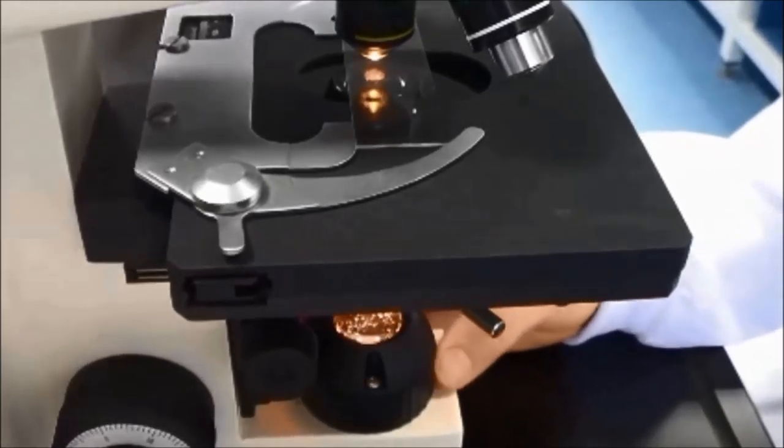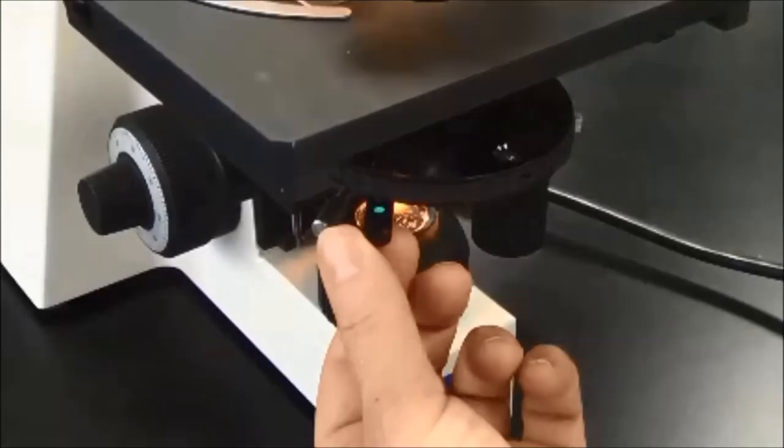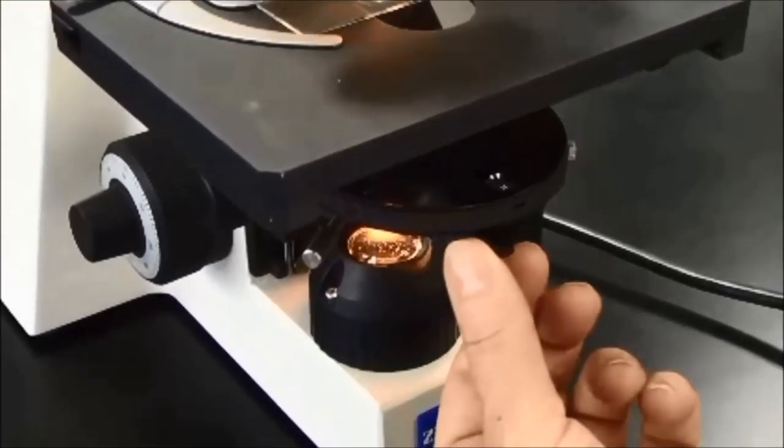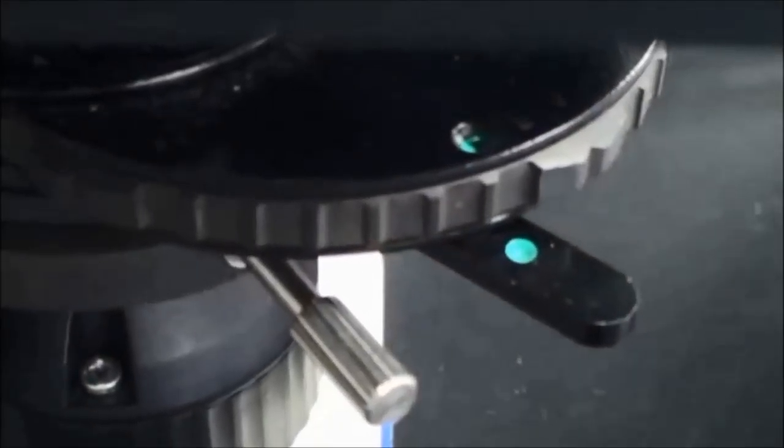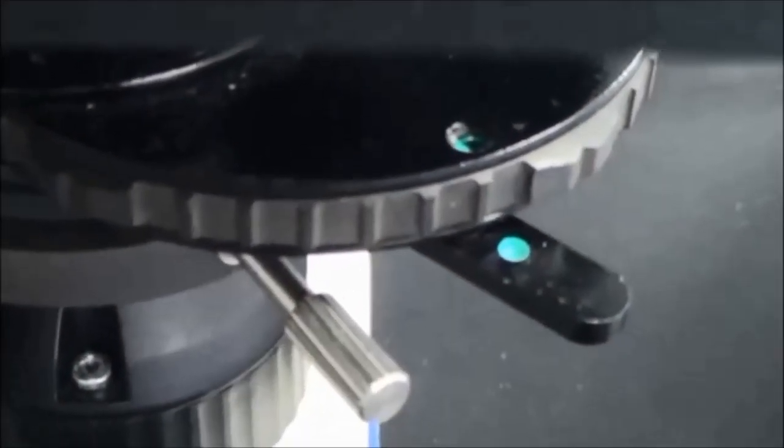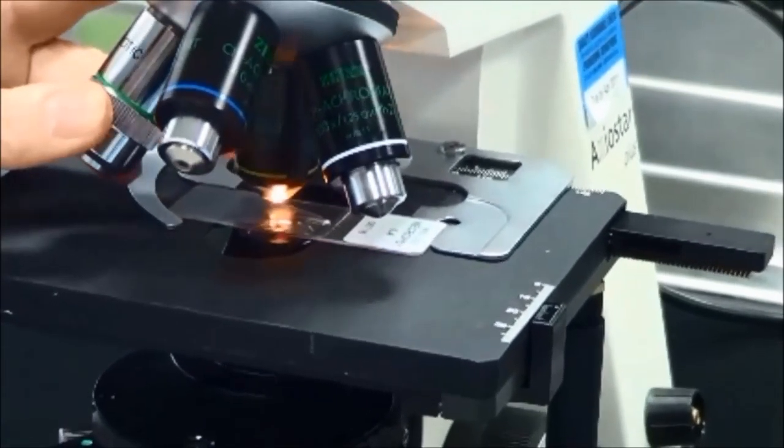Fully open the luminous field diaphragm at the base of the microscope. If a phase stop or dark field position is set on the turret condenser, a green dot appears in the window of the aperture diaphragm, indicating that the stop must be opened completely. That is, the green dot on the aperture diaphragm lever and in the window must be in alignment.